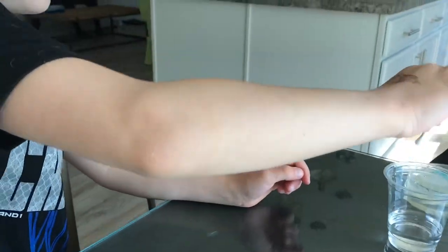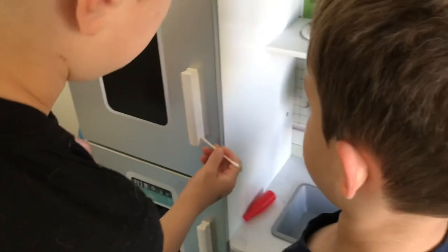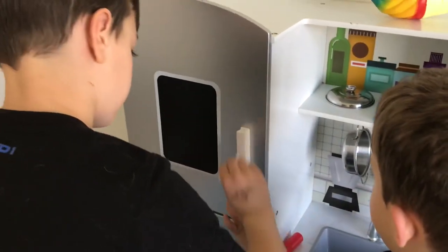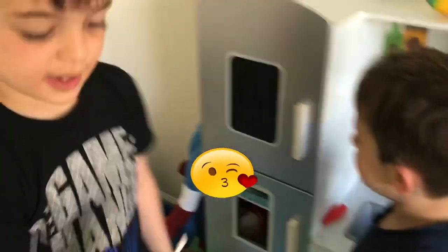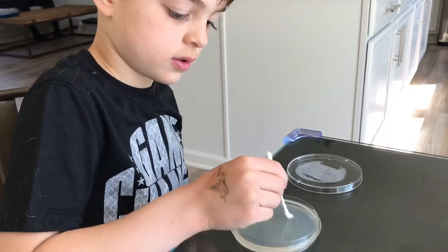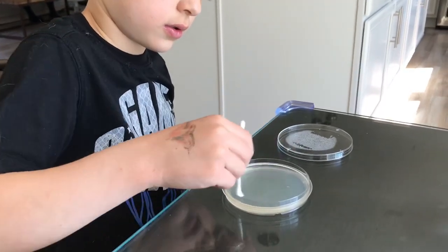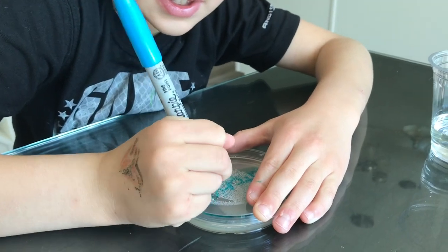Let's go in the playroom. We're gonna do the door handle and one of the toys that they always play with. Get it good. C-H-E-M. Let's go on to the shoe.